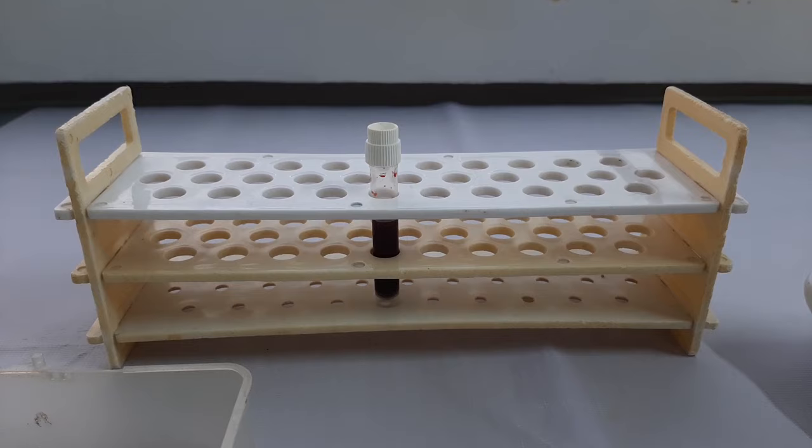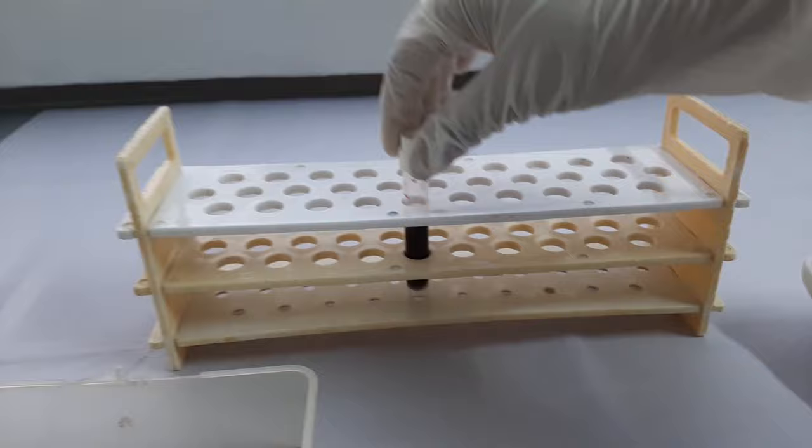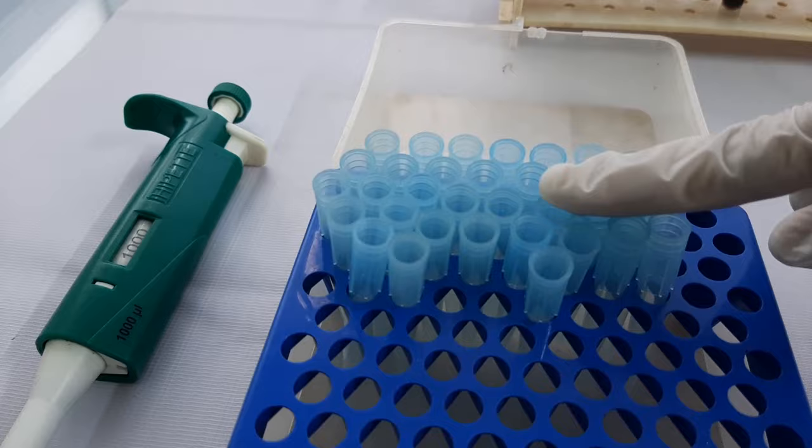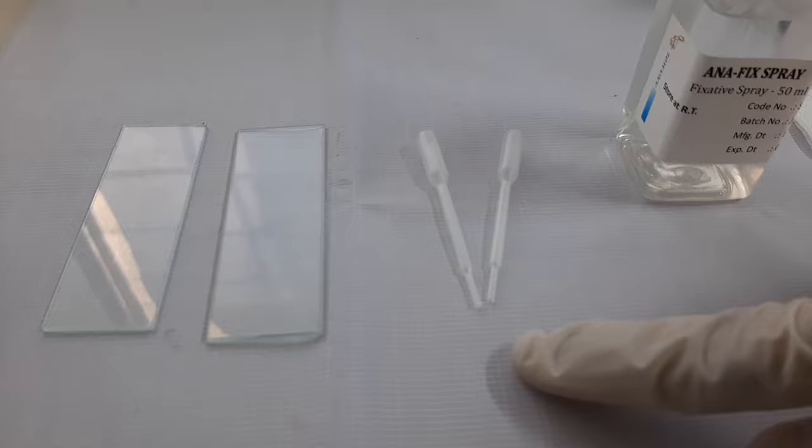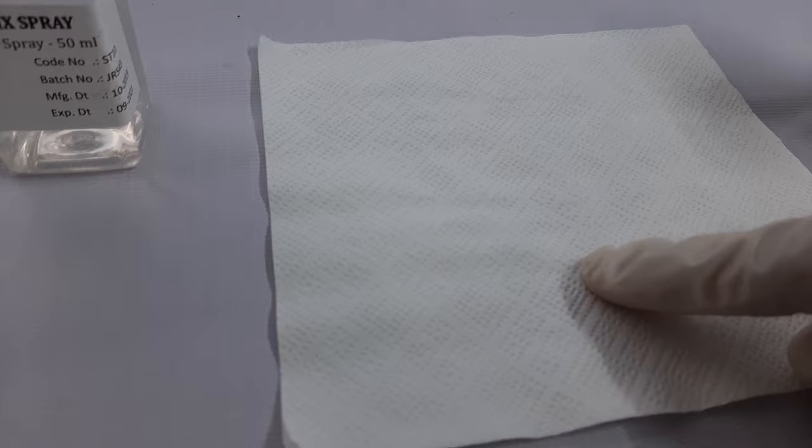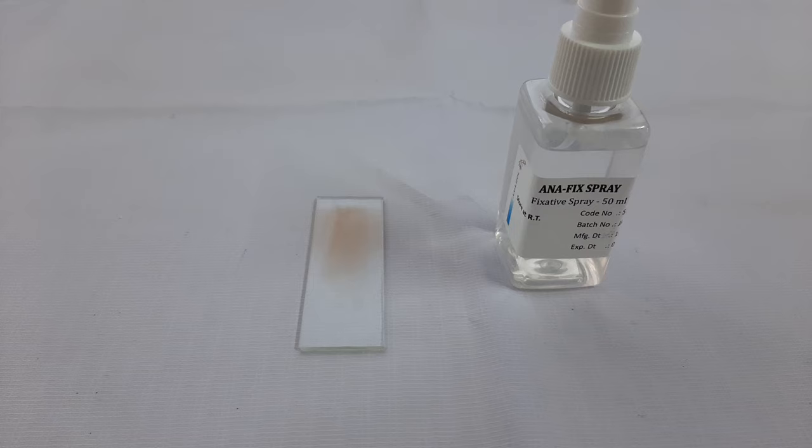Apart from this, you may require additional items such as patient sample, clean and dry pipettes, clean and dry tips, clean and dry glass slides, sample dropper, fixative spray, tissue paper, immersion oil, and timer or stopwatch.